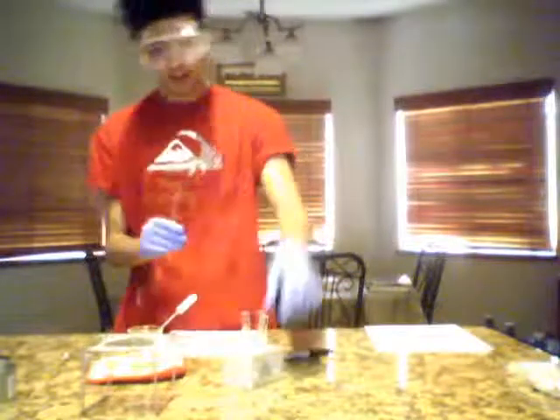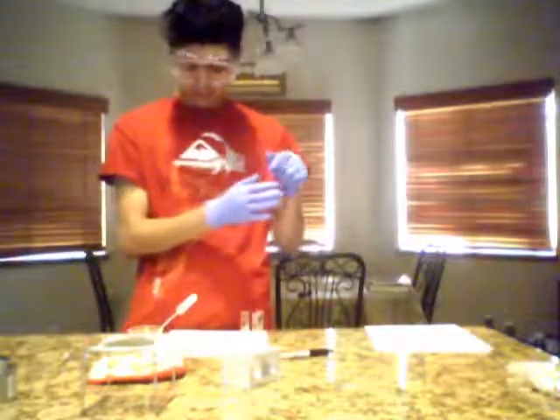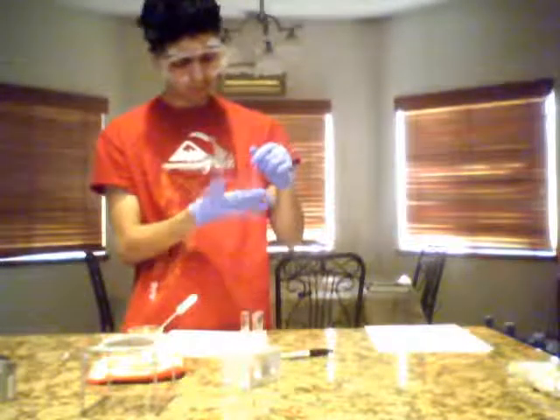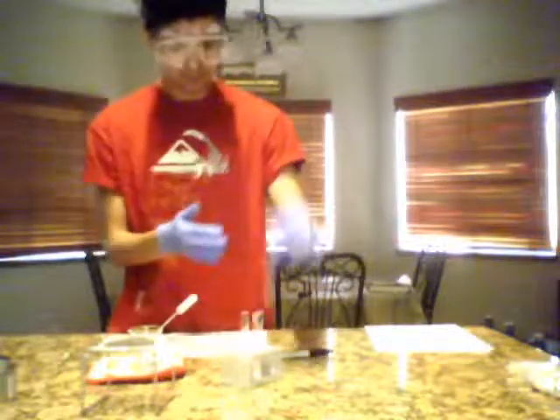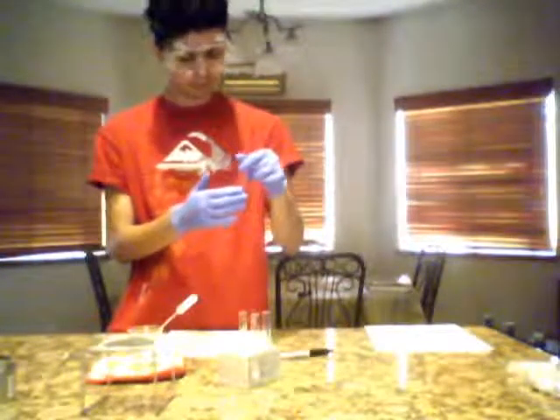So we're going to go ahead and give these a really good shake. We're going to have to stop the timer. Hold on.